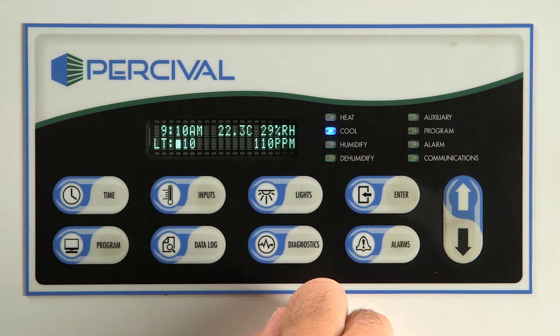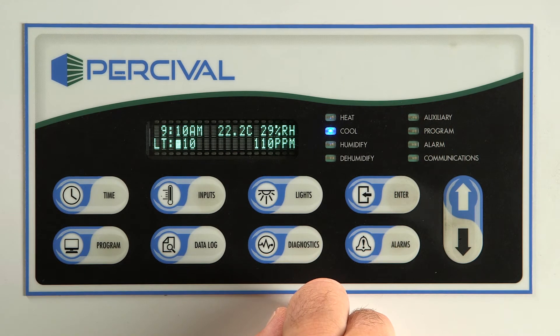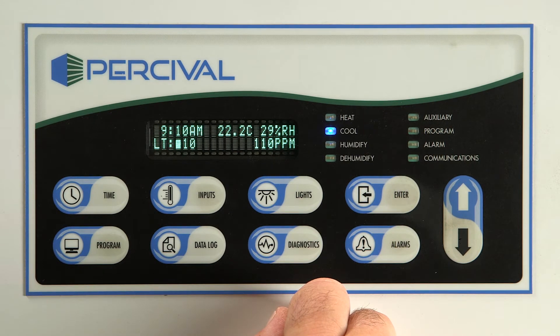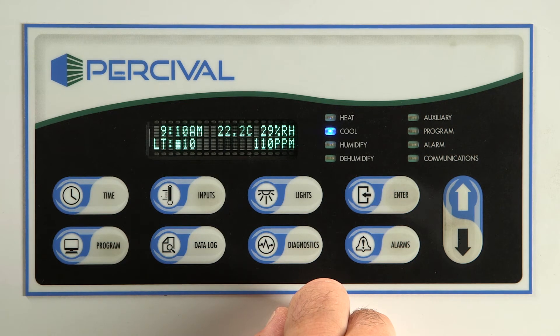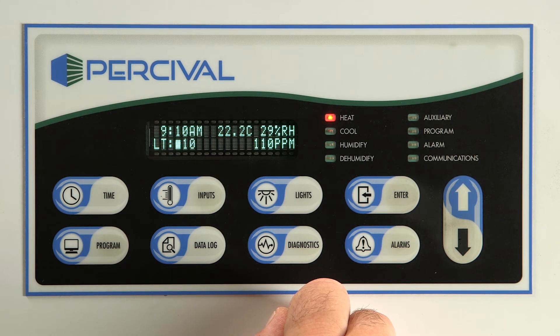It is important to note that if the program LED is illuminated, you cannot override any setting like temperature, light, or humidity values unless you switch the controller to manual mode.